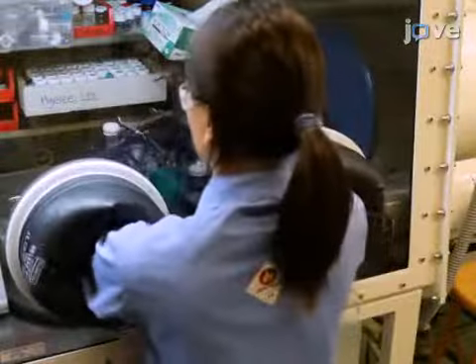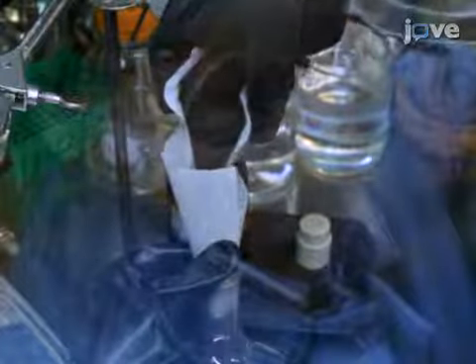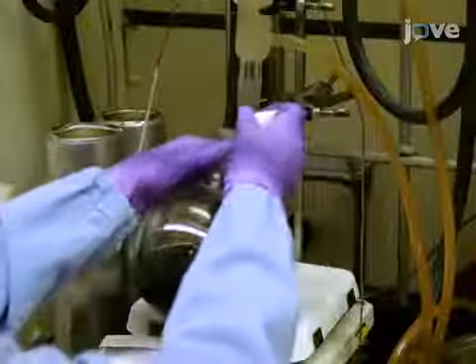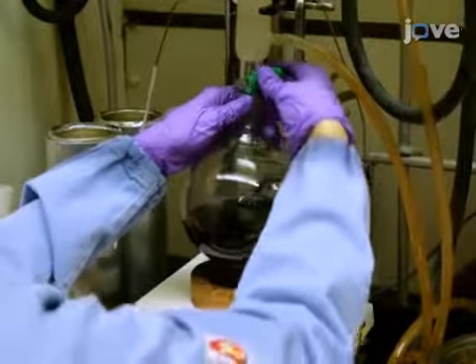To begin this procedure, prepare the ring-closed product as outlined in the text protocol. Add 14 grams of palladium on carbon to this prepared product in toluene. Then remove the flask from the box. Fit the flask with an oven-dried 24/40 reflux condenser that has been purged with nitrogen and equipped with chilled water.